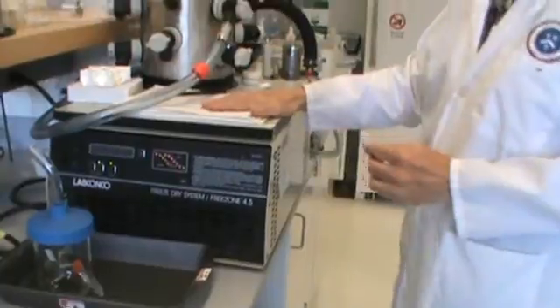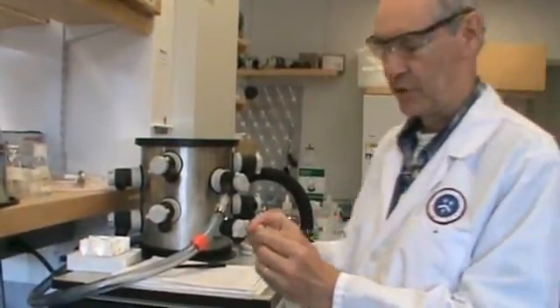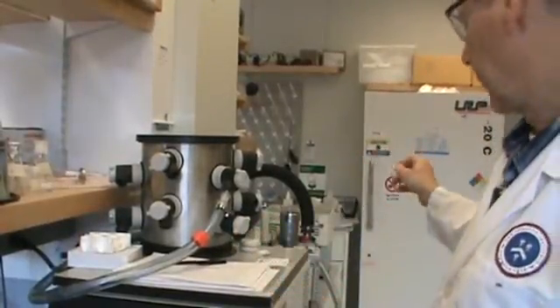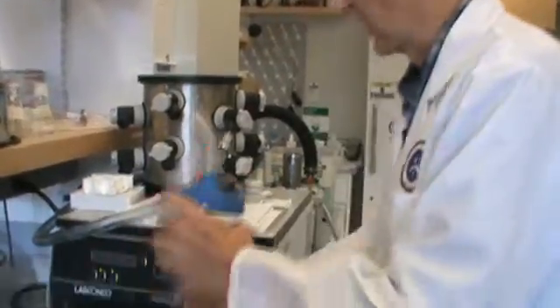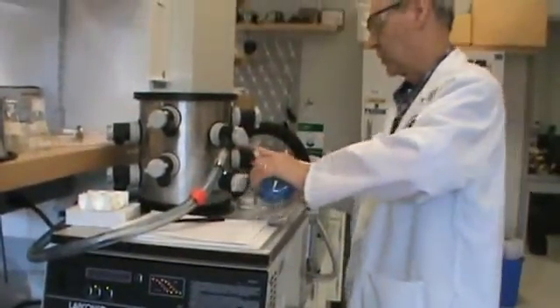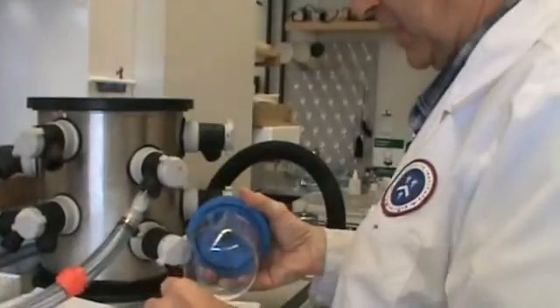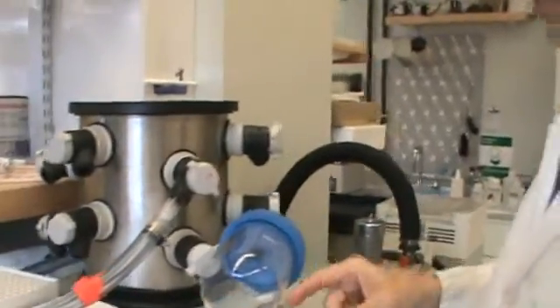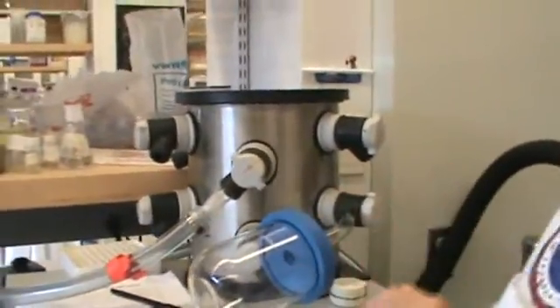I forgot to mention the sign up sheet. If you use, well I prefer these two mil tubes in the centrifugal concentrator. First we'll show how this would go. This would just go in here. And I like to keep it insulated. Some people put a towel around it or some insulation so it doesn't pick up too much heat which would tend to thaw your sample.